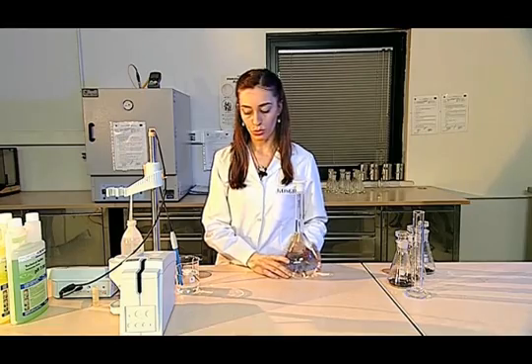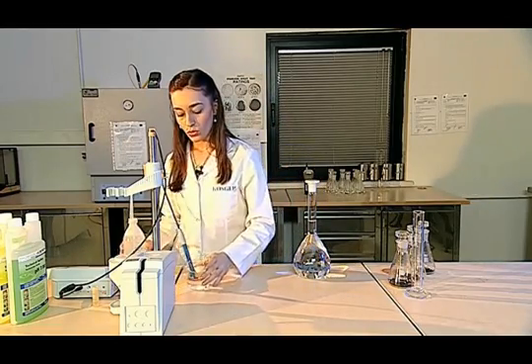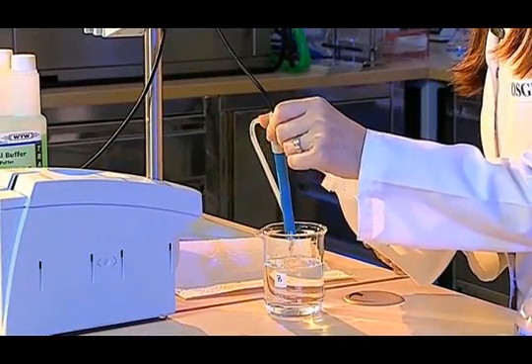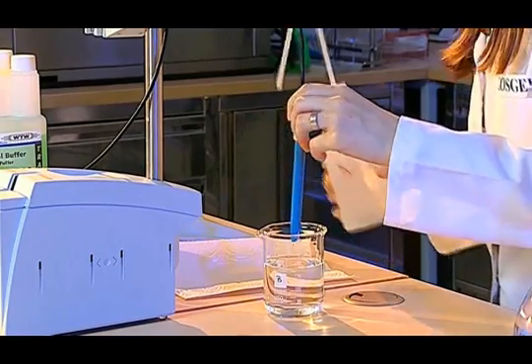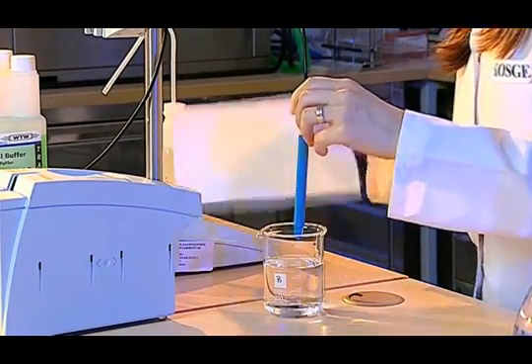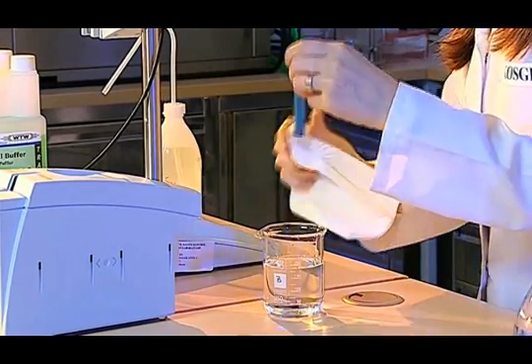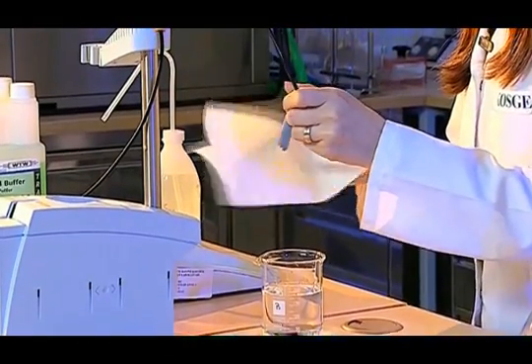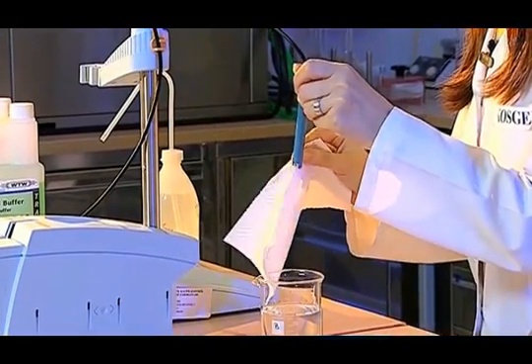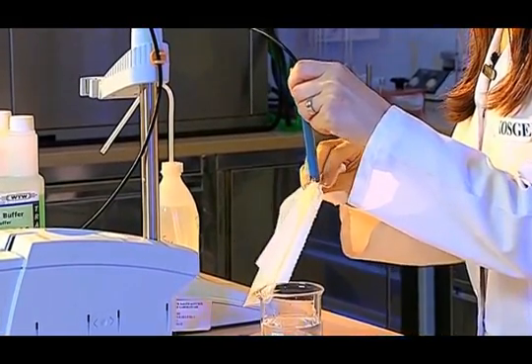I adjust the calibration of the pH meter to measure the pH of the potassium chloride solution that we have prepared. Therefore, we wash the tip of the electrode with distilled water first. Then, we slowly dry it with the edge of a napkin and we especially make sure that everywhere is dry.